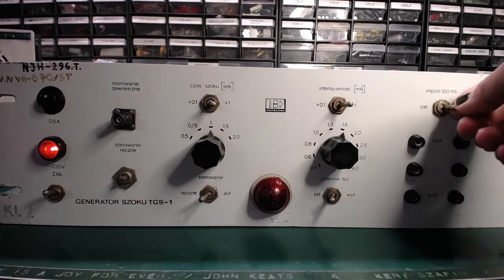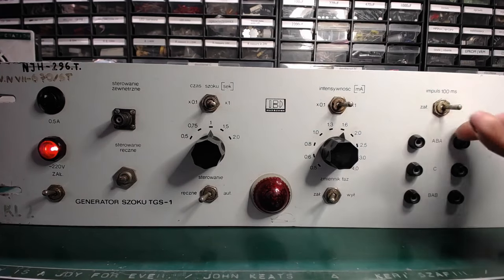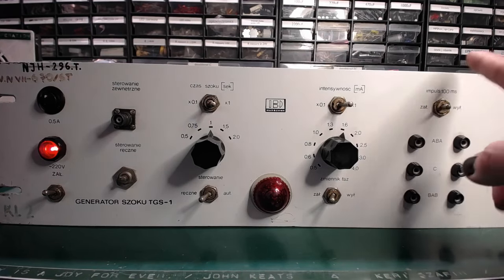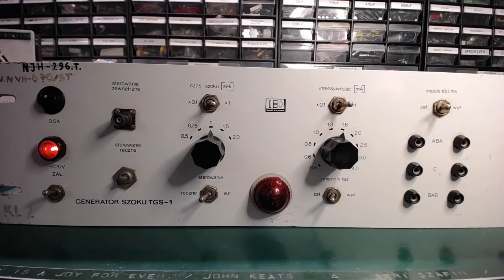So the last control is the 100 millisecond pulse, and this will change the state of the contacts of a relay for 100 milliseconds after the shock is delivered.